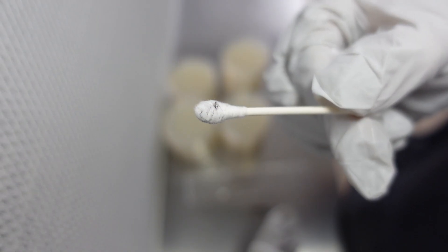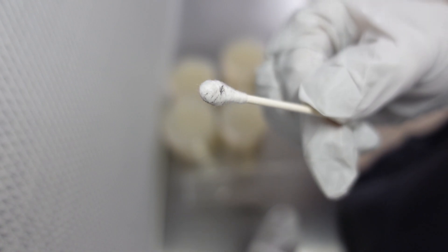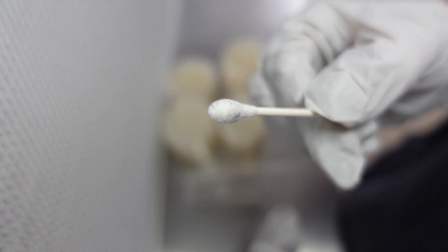To germinate the spores, start by preparing a clean work area. I am working in front of a laminar flow hood for this, but you can also use a still air box.